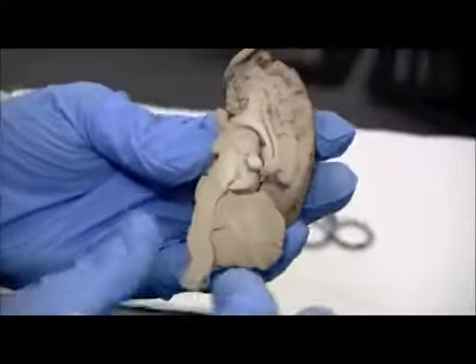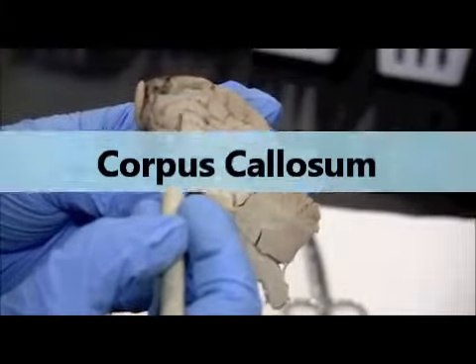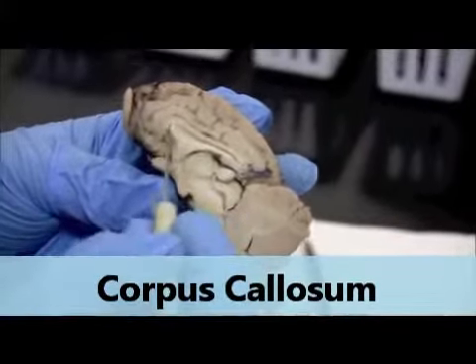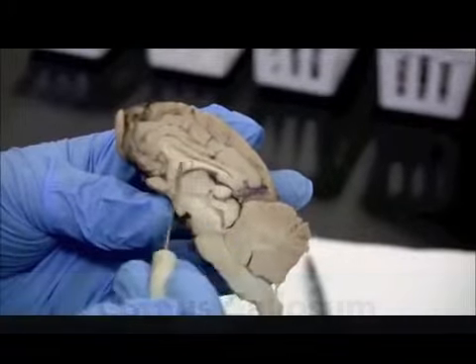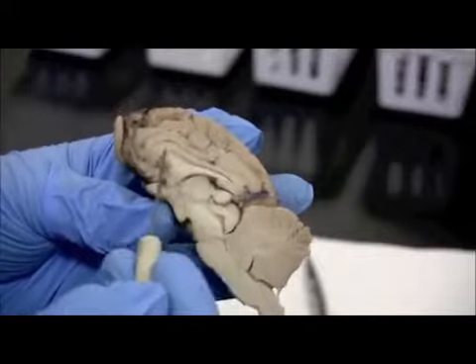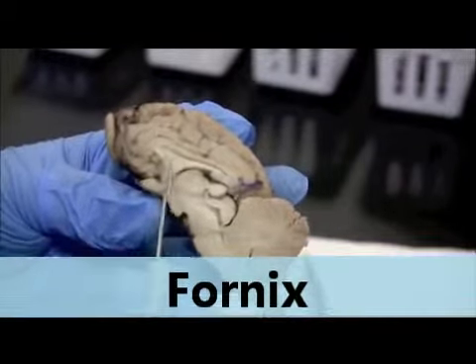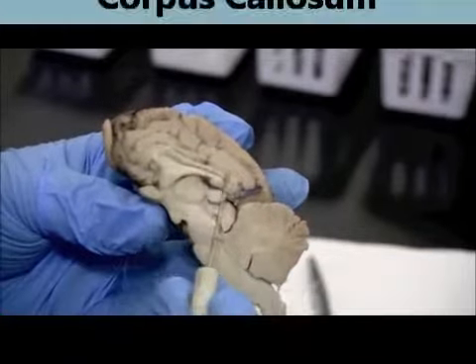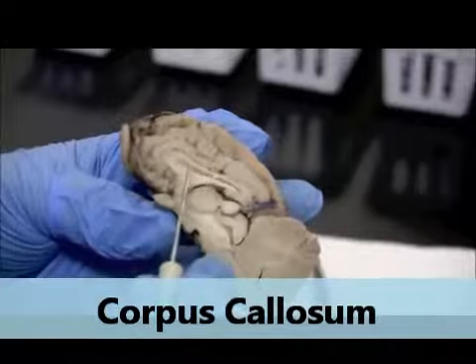So we can see a really good landmark in the middle here. This is the corpus callosum. This little arch that comes up here, and this loop, if we follow it like a circle, the inferior portion is the fornix down here, but this top is the corpus callosum, those fibers that connect the 2 cerebral hemispheres.